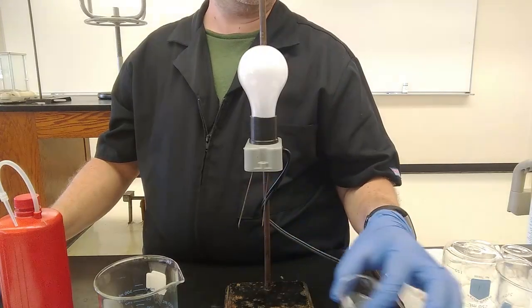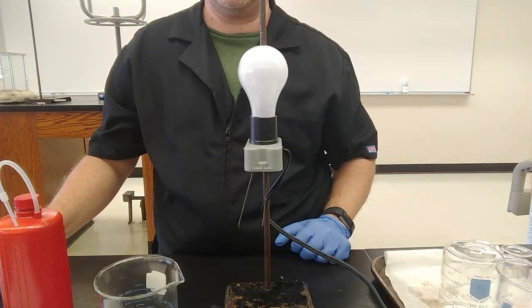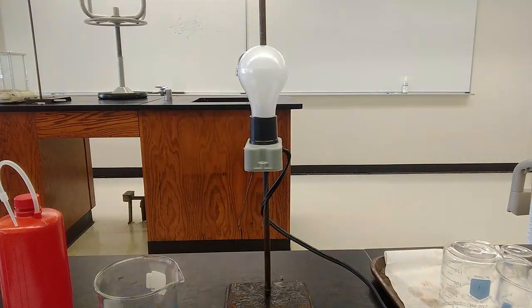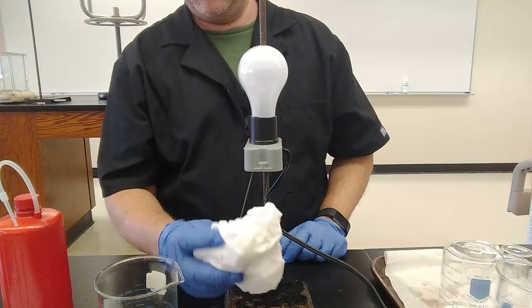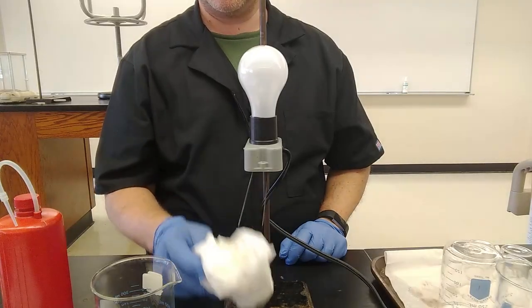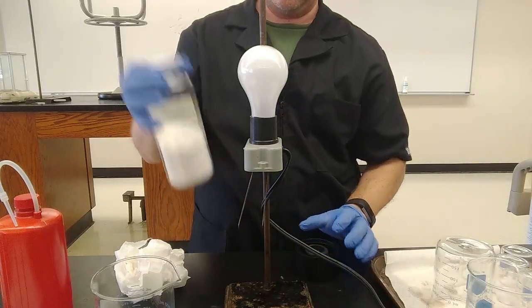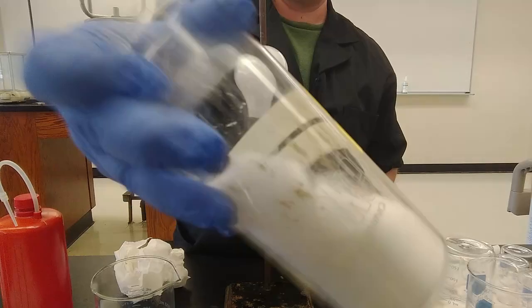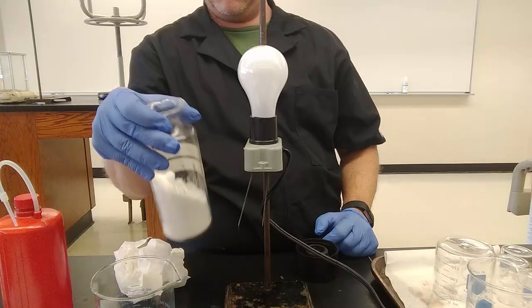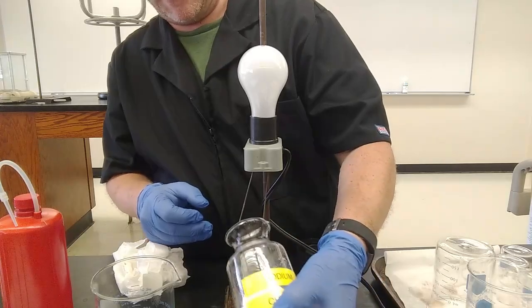Next up, sodium chloride. I need a paper towel to make sure that my electrodes are dry before I dip it into, you'll note that it says sodium chloride, NaCl, solid table salt. Top not stuck on the bottle particularly well. All right, here is a jar of table salt. It's gonna be too far down in there for me to reach with the electrodes, but I think I can shuffle it up a little bit, and let's see what happens.